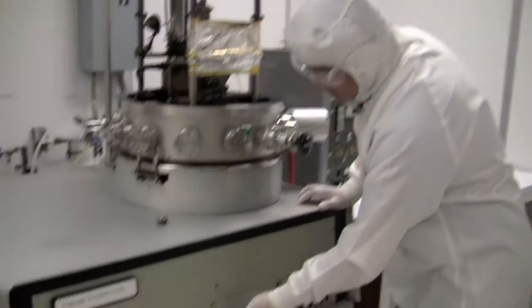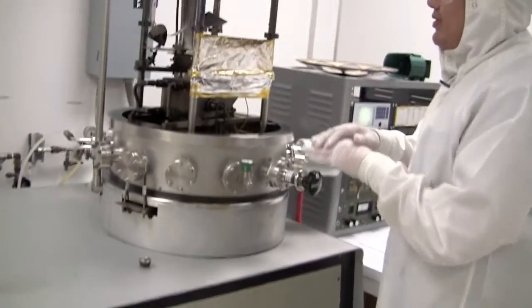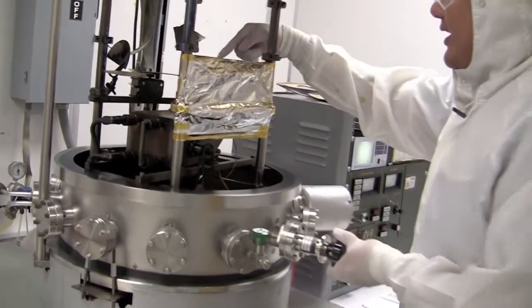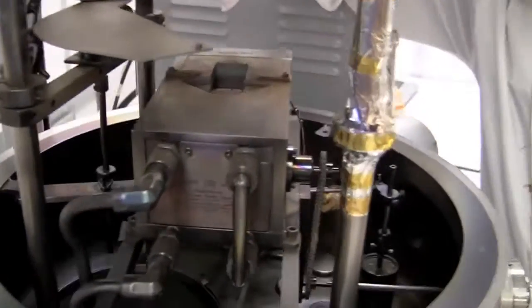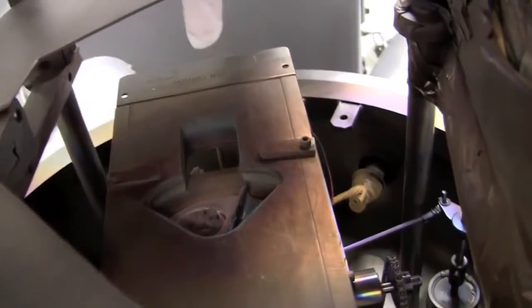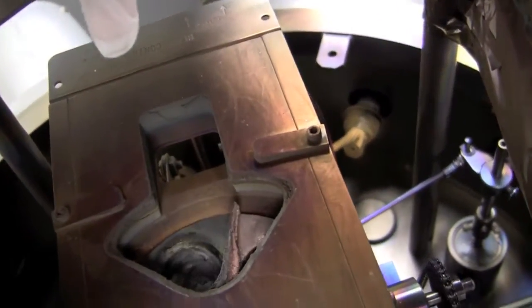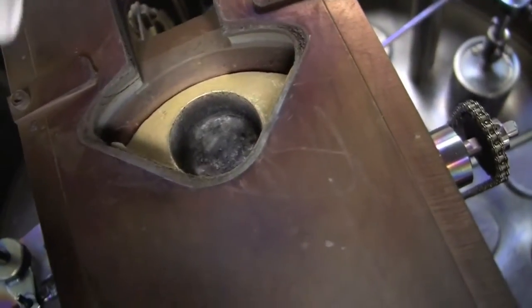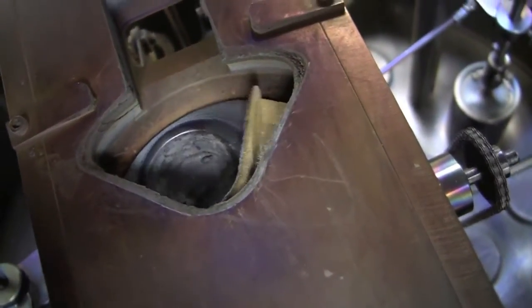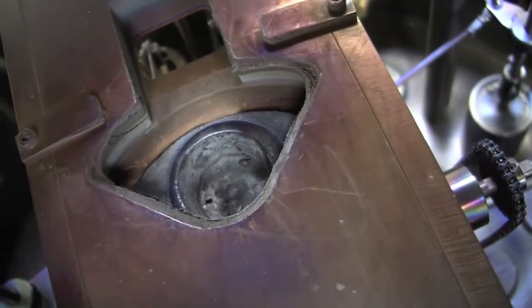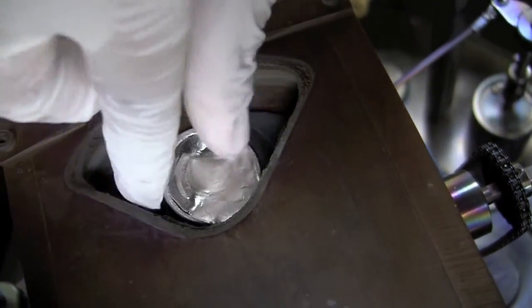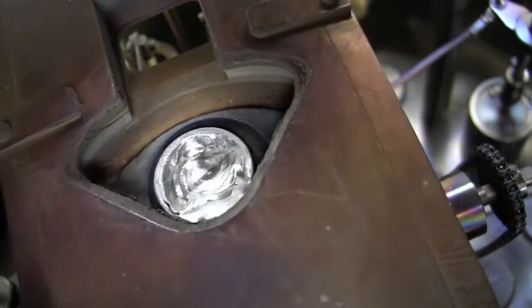We'll open the shutter so we can see our samples. So we can turn this until we find gold. So if we look inside, we can keep turning it, and gold is right there. So we know that it's one after the gold. So we know this is the slot for titanium. So we put it in here to make sure it's in, and then we close our shutter.